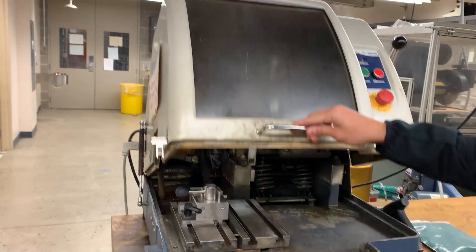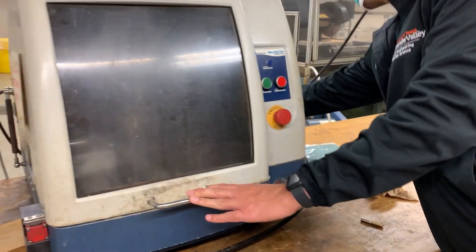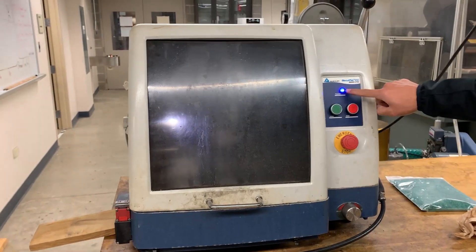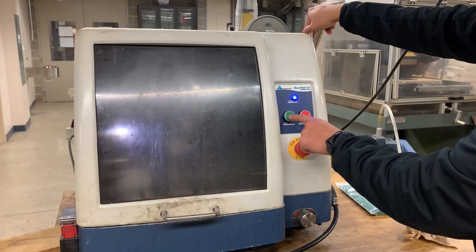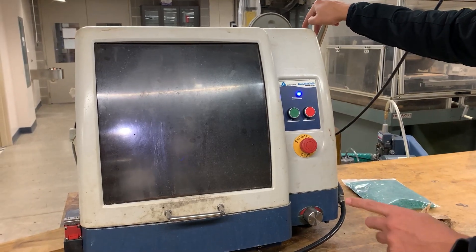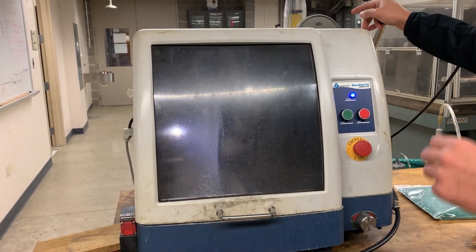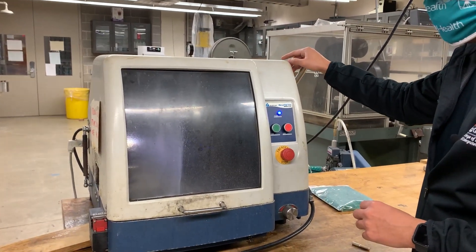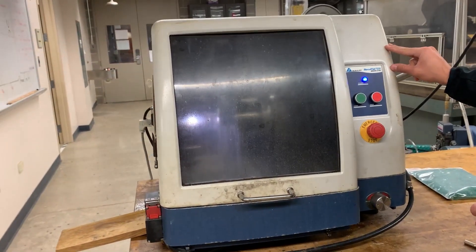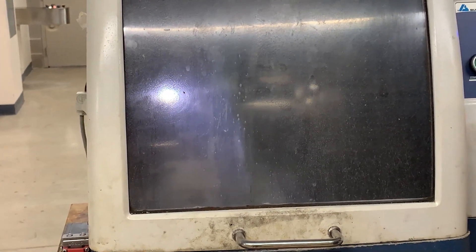I'm going to lift the handle up for the cutting wheel and close the abrasive cutting machine. I'll turn it on by flipping the switch on the back right-hand side. I'm going to hold the handle because the initial jolt of the motor starting is going to jolt it a little. We want to be sure that there is coolant or fluid always flowing before and after the cut — we will never cut a sample inside the abrasive cutting wheel without fluid or coolant.